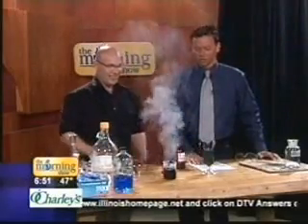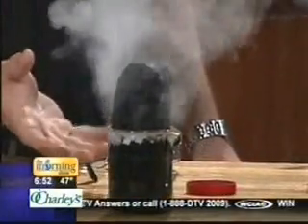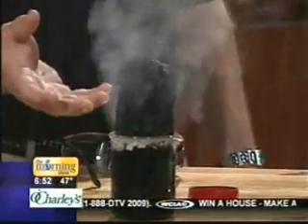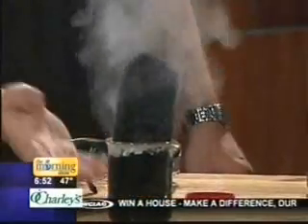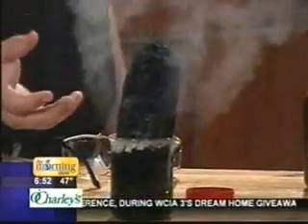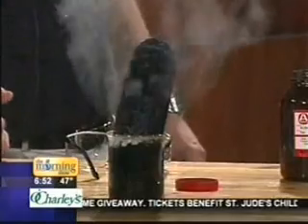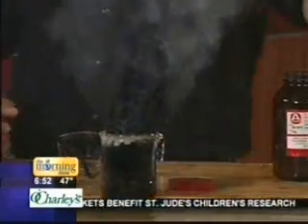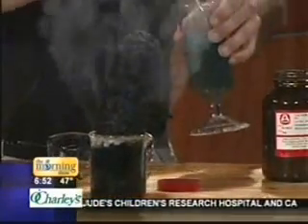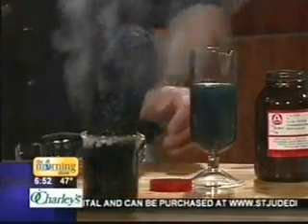Okay, here we go. I think this one's working. There we go, this one's going to work in a second. As we go, you can see a lot of steam is being evolved. You don't want to breathe that, though. And there's a lot of air in there, so as it removes the water, it's puffing up. We're making our own Cheeto, although it's a burnt Cheeto. It kind of looks like those little snake things, the black snake, from fireworks. It's kind of cool. Look, it's coming to get you.